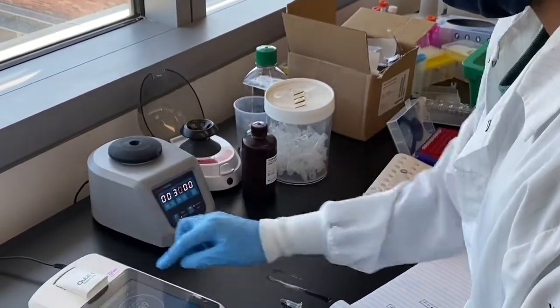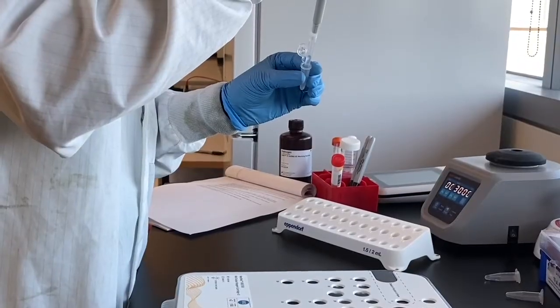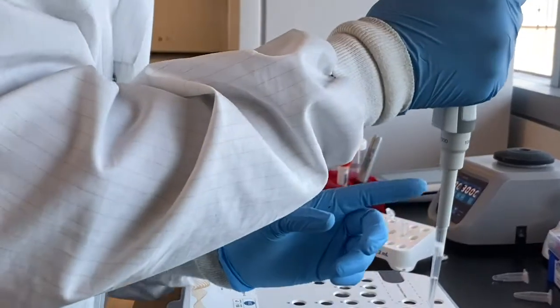Next, we measure the concentration of the library using the qubit and adjust it to the appropriate concentration for the sequencer.